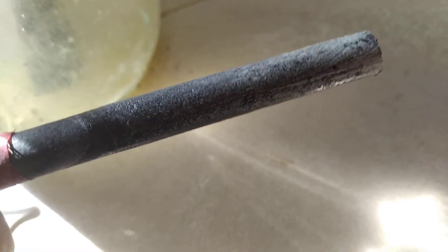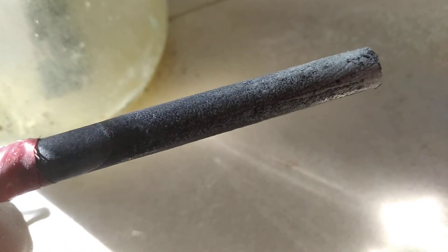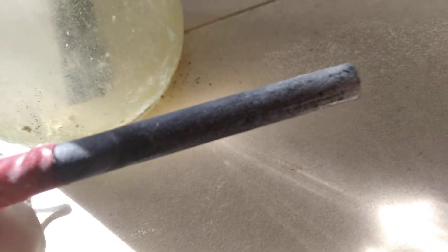Due to the contrast it's kind of hard to see but there you go. Now this is actually what's controlling the pH because the calcium chloride is gonna produce calcium hydroxide on the cathode.